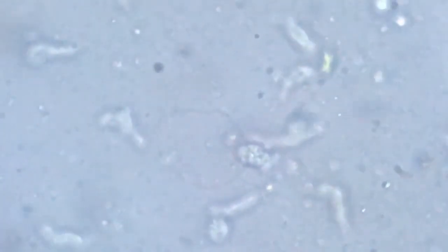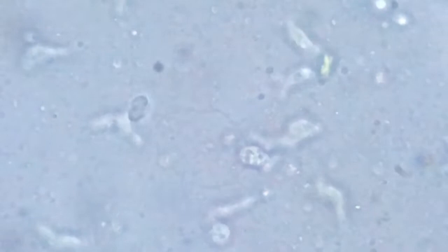Nothing much seems to be happening here. So we go back. Countless of them.